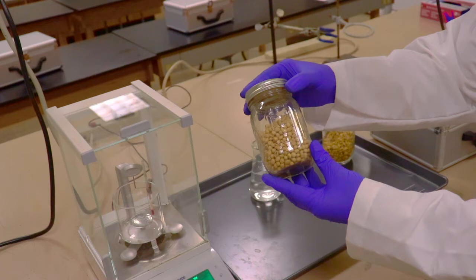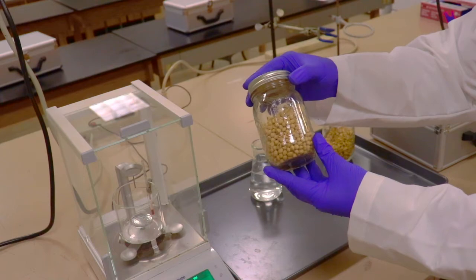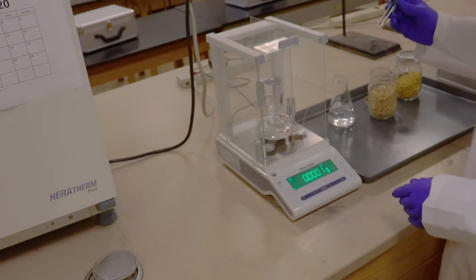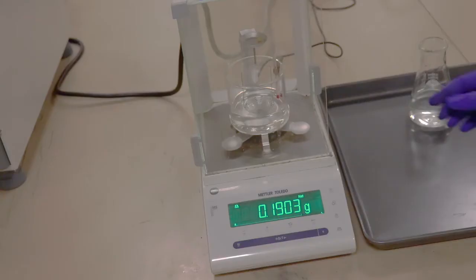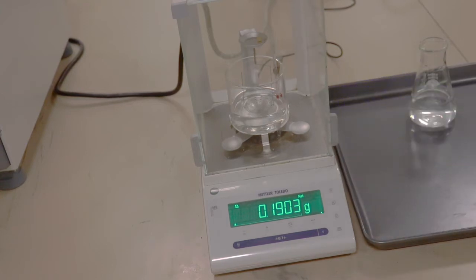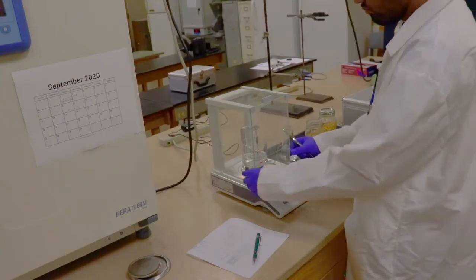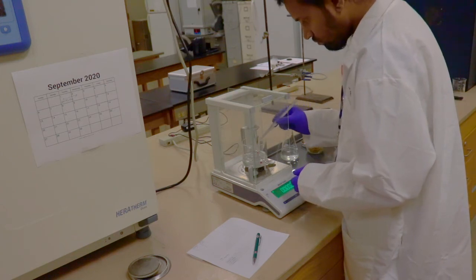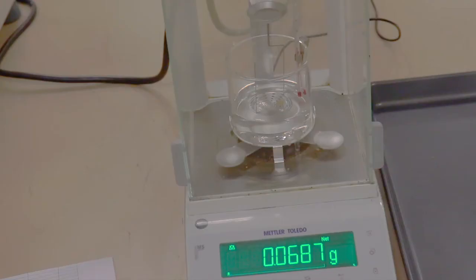After setting up the density determination system, we can start to determine the volume and solid density of a soybean kernel. Pick up a soybean. Put it on the weighing pan, and then determine its weight in air. After that, completely put the soybean into water, and then determine its weight in water.